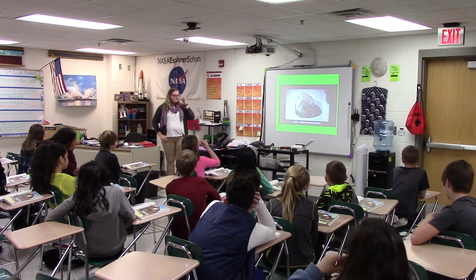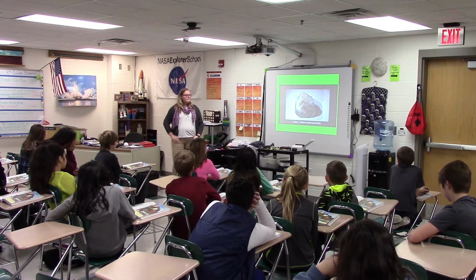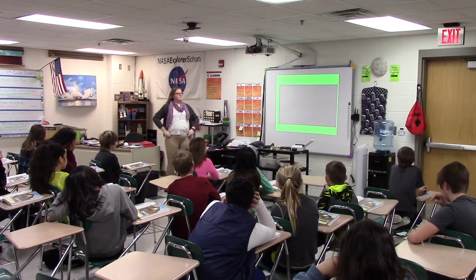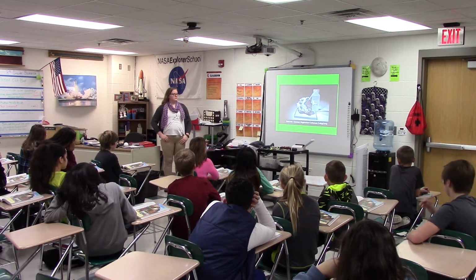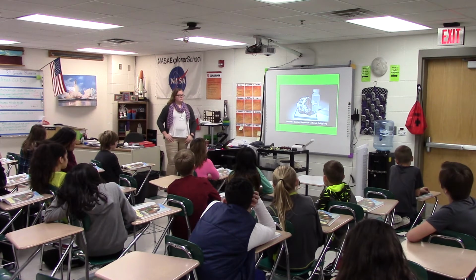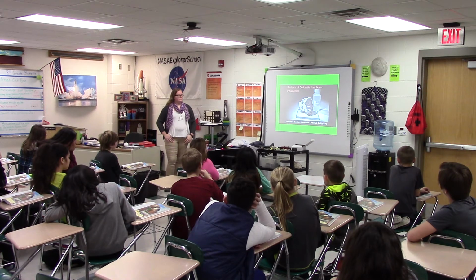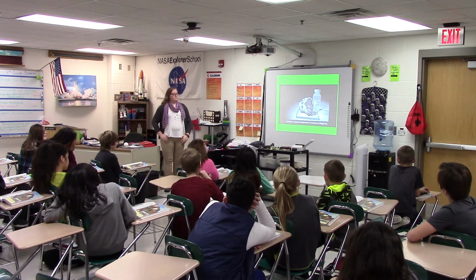This is a cleavage fragment of calcite, or calcium carbonate. As hydrochloric acid is placed on the mineral, there is a rapid and vigorous reaction. This is a specimen of dolomite crystals on a dark gray rock, which is also dolomite. As the acid is placed on the dolomite, there is only a weak bubbling or reaction. Now, an area of the dolomite has been scratched to produce a powder. When the acid contacts the powder, there is a more vigorous reaction. The dolomite powder has a much greater surface area to which the acid can react.